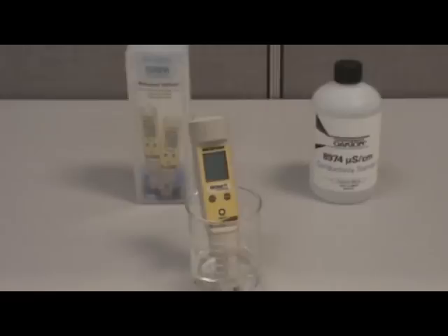Today we are calibrating the TDS Testr 11. This calibration procedure is the same for all the testers in the series. To perform this calibration, you will need the following: a beaker, calibration solution, and a tester.